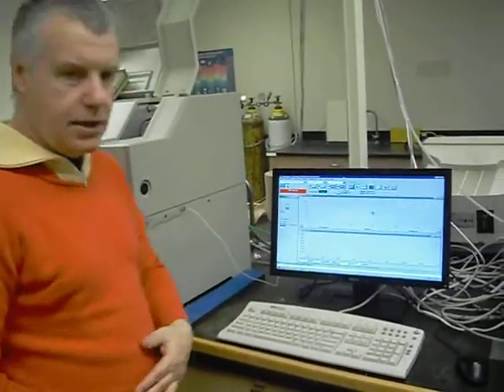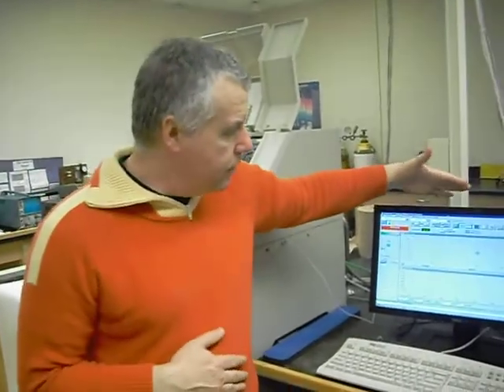Here's ChemStation. It's not the very latest version, but we have later versions, and I've used them, and they're the same. So I consider it a nice resume item, if you can say you're familiar with ChemStation. If you want to work in the sector, it's like, oh cool, they know ChemStation. It means you're armed.